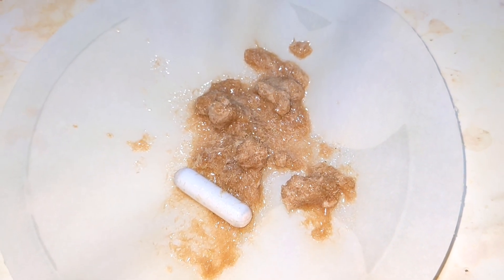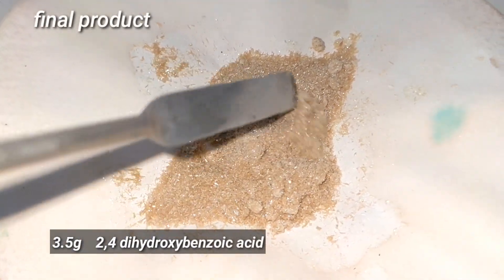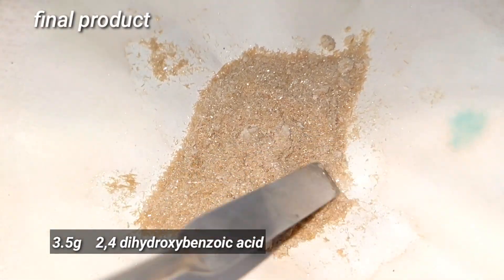If you want, you can again do a recrystallization to get a much finer product, but I didn't bother doing that.